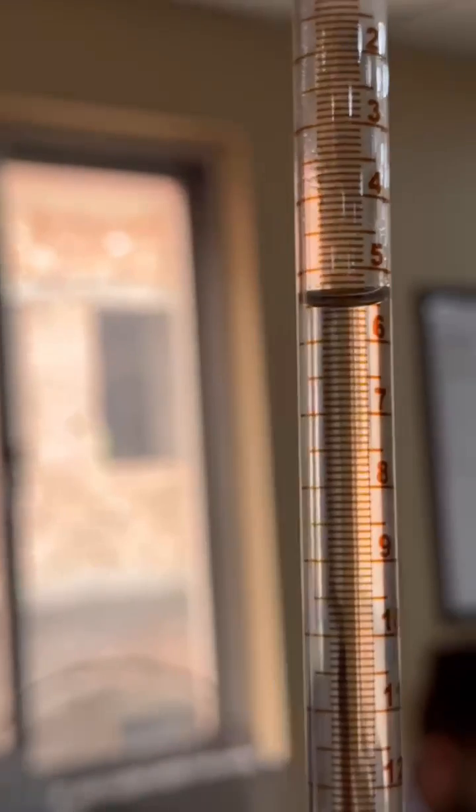Note the reading of the burette and start mathematical calculation to determine the titratable acidity.